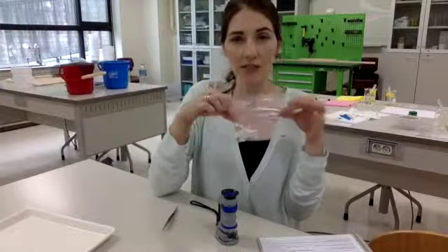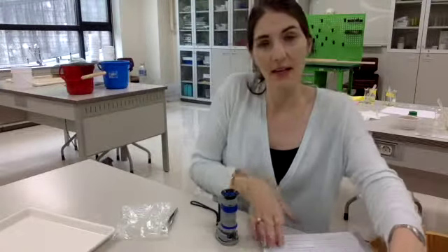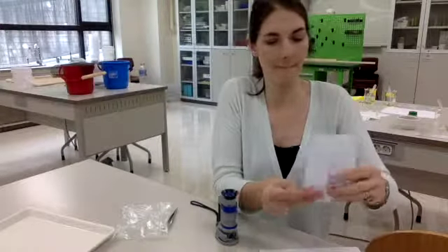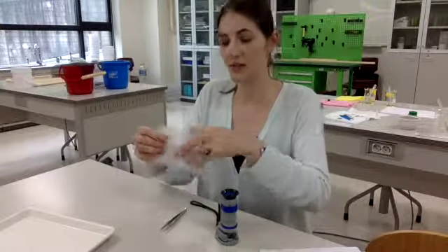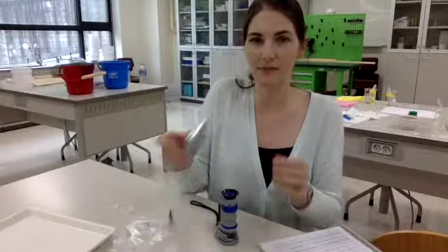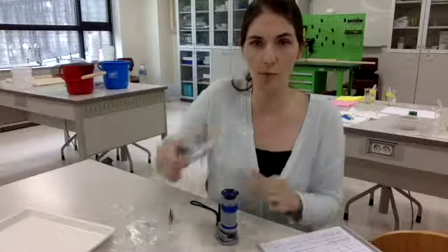Make sure that all of your samples get back in your plastic bag, that your name is on your sampling sheet, and that you went ahead and filled it out. And then you can fold it up. And voila, ready to go. Oh yeah, don't forget to turn everything off and clean it up. Scale, turn it off. Microscope, turn it off.